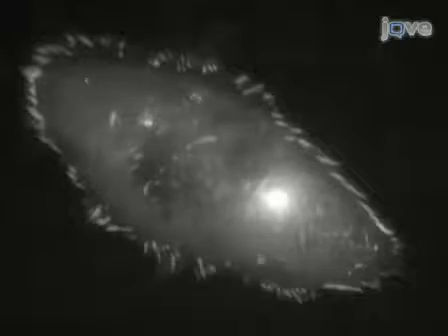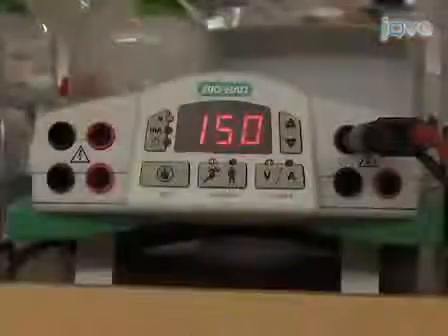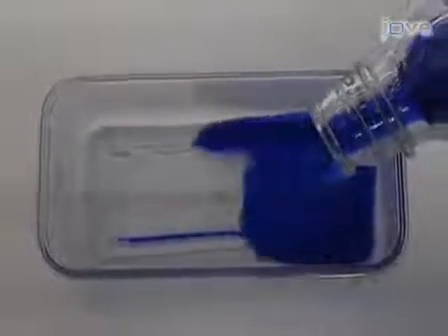In the cell, the actin cytoskeleton is a dynamic structure and its remodeling is important in a variety of processes, from cell division, cell migration, and vesicle transport. A wide variety of proteins can bind to the actin cytoskeleton through distinct actin binding modules. In this video, we demonstrate the procedure of actin co-sedimentation, which is an in vitro assay routinely used to analyze proteins or specific domains of proteins that bind filamentous actin.